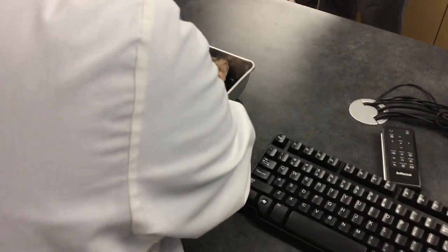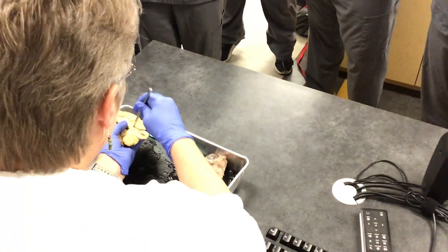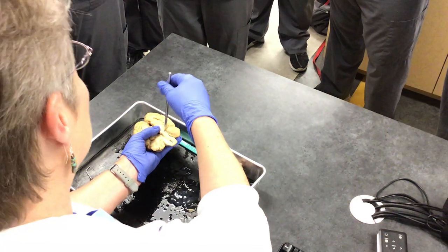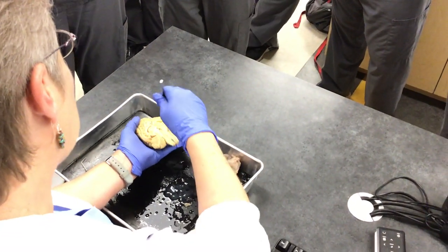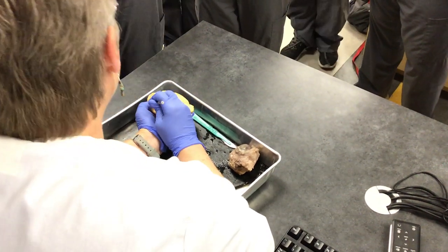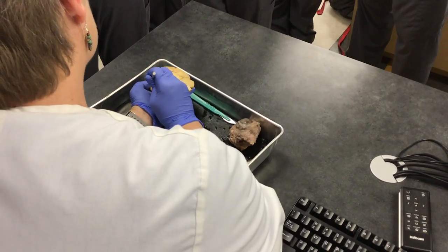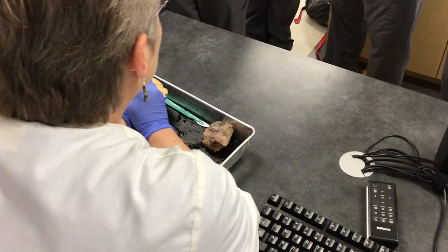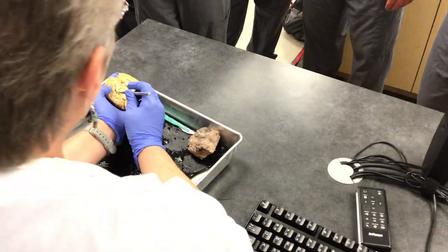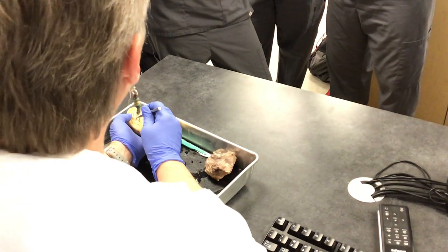This is the cerebral aqueduct right in there. And coming back up here to the corpus callosum — if you open it up, there should be a darker pigmentation in there. That's referred to as the choroid plexus. In the choroid plexus, we have what are called ependymal cells, and those ependymal cells will produce cerebrospinal fluid.